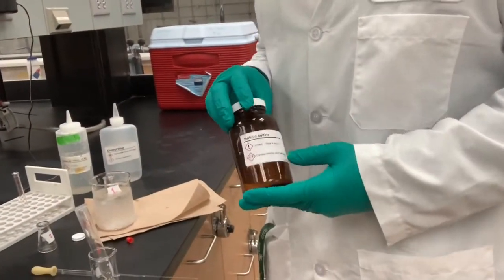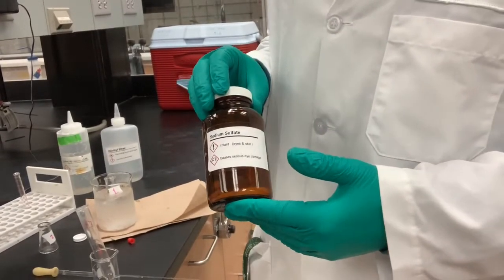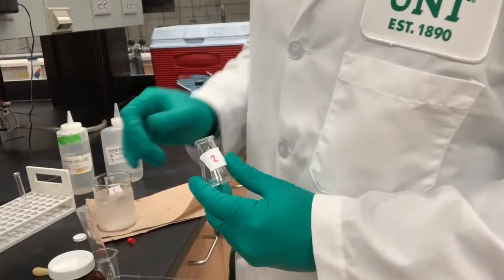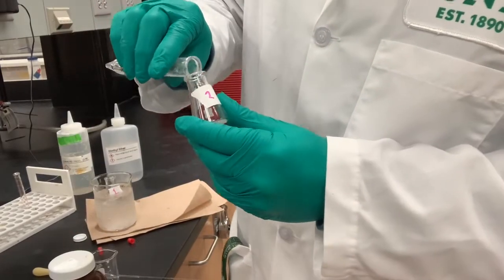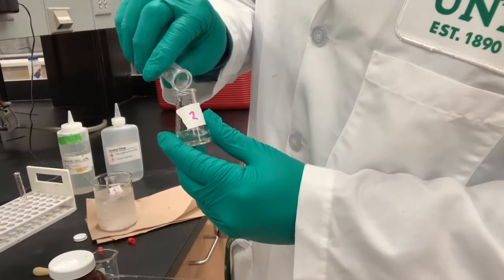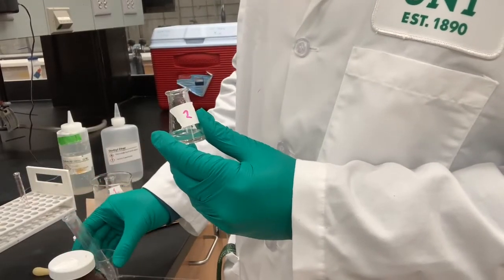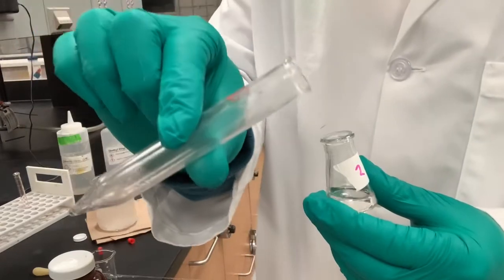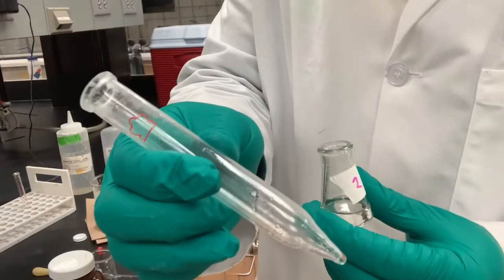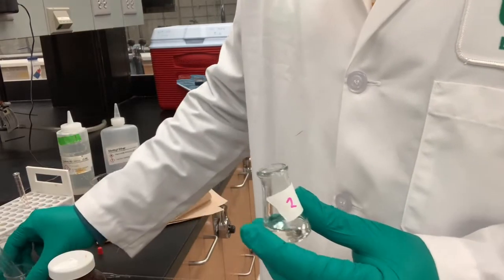Hey guys, so while I'm waiting my 5 minutes, I'm going to move on to step 7. Step 7 is to add sodium sulfate into Erlenmeyer 2 that also contains the top layer. It says to put 3 spatula tips full in there. And if you notice, there is a frostiness to this glass now. That means some of the powder stayed behind. This will be a source of loss when we do our yield or our recovery at the end.